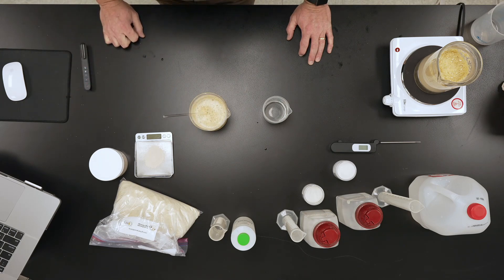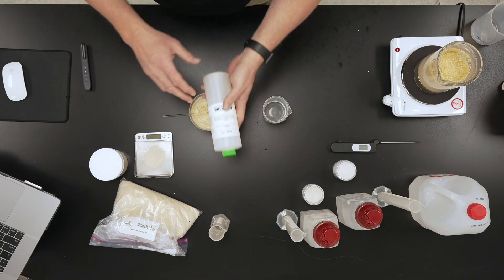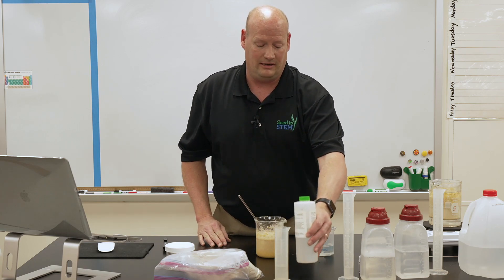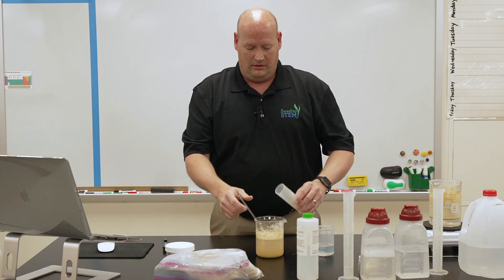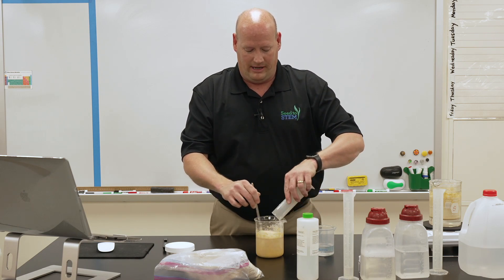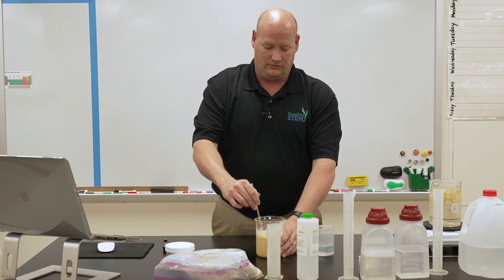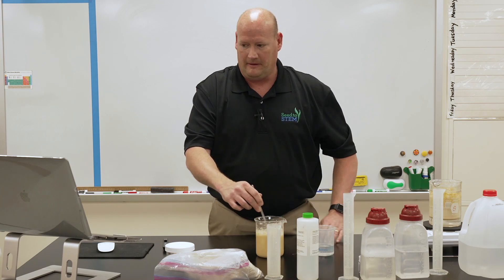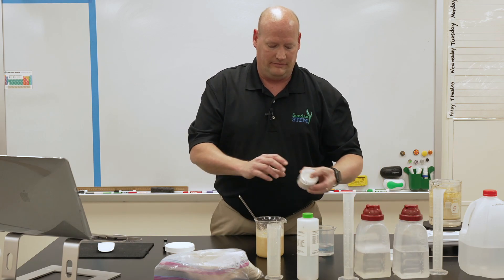Once your 10 minutes of stirring is done, add your buffer solution. The buffer solution is to maintain a pH of 5, keeping it slightly acidic. The pH buffer ensures we have a little bit of acid in there to keep that solution acidic so that the sugars will start breaking down more easily. Then we add our glucoamylase, which is going to break down those sugars even further.